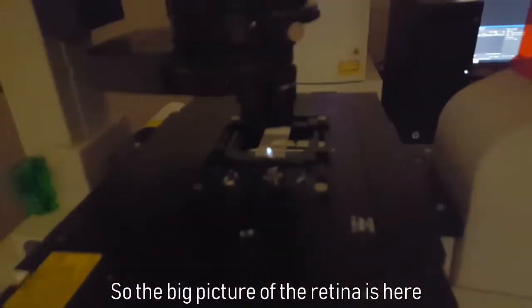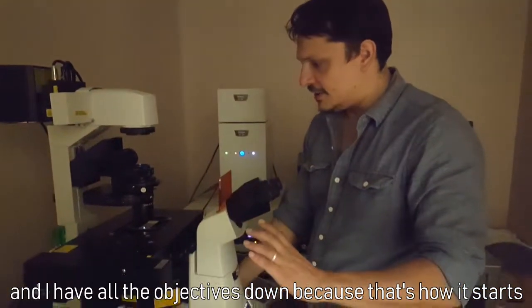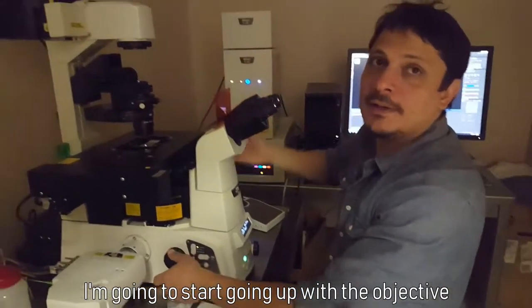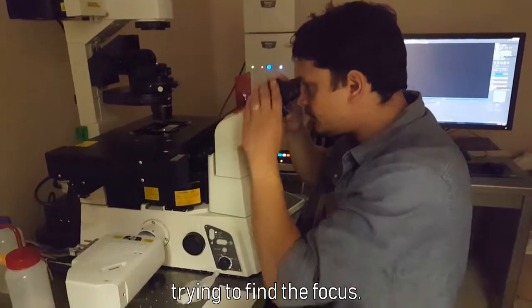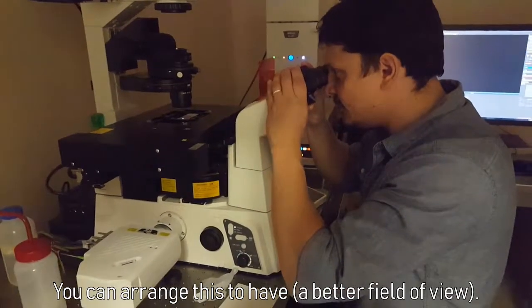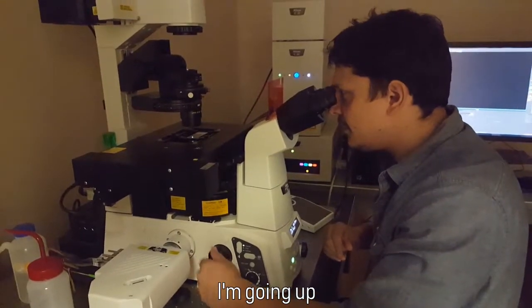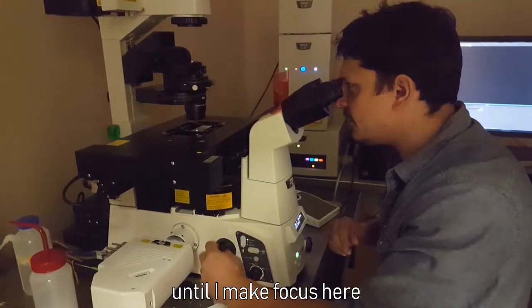So having the big picture of the retina is here, and I have all the objectives down because it's how it starts. I'm going to start going down, going up with the objectives, trying to find the focus. You can arrange this to have binocularity and going up until I make focus here.